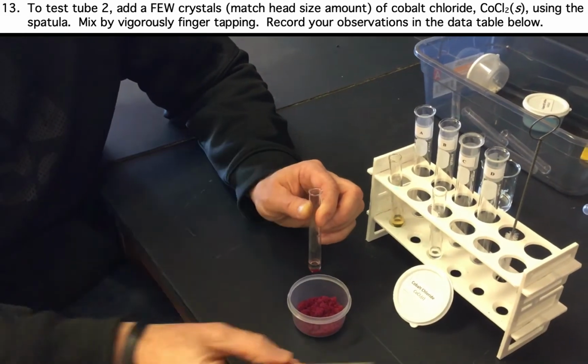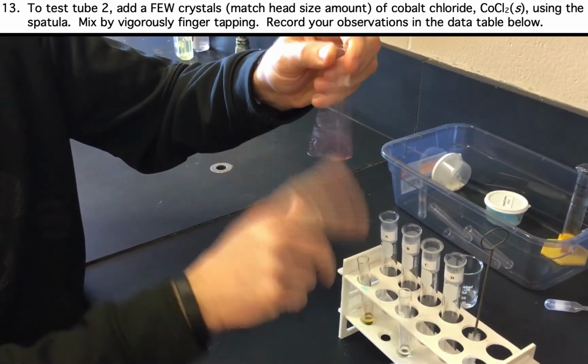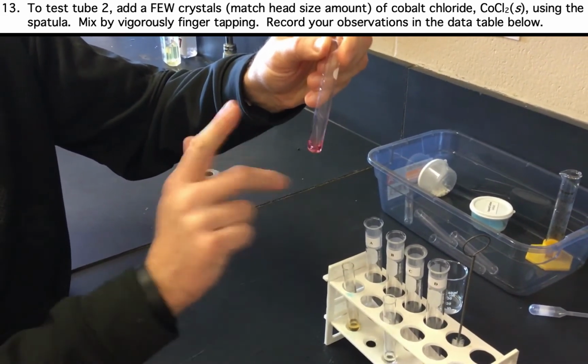Now we will add a small amount of cobalt chloride to the distillate, finger tap, and make observations. Once again, record these observations in the data table on page 2.